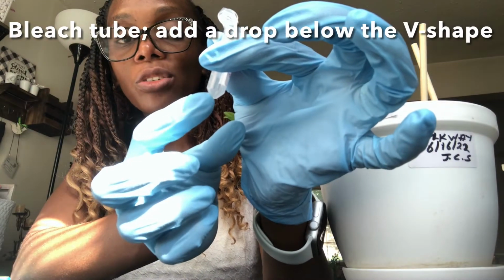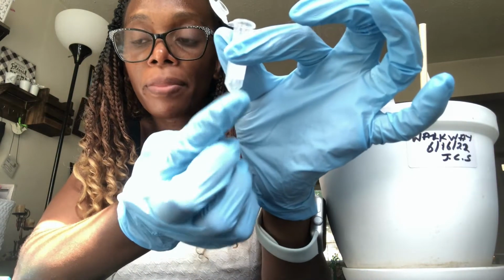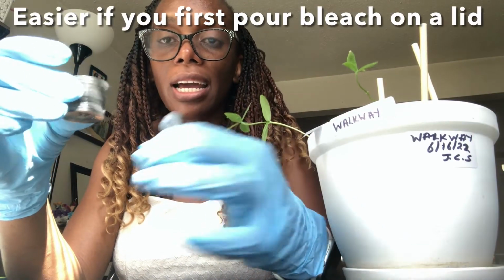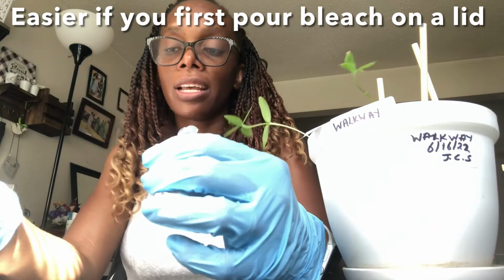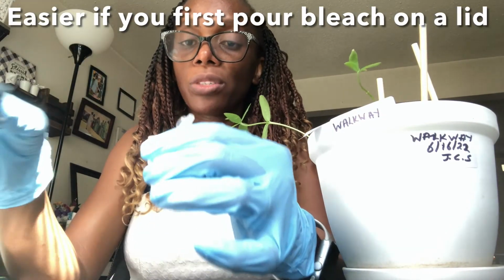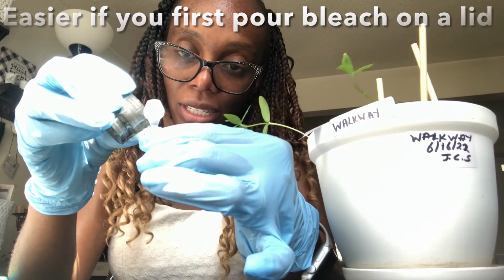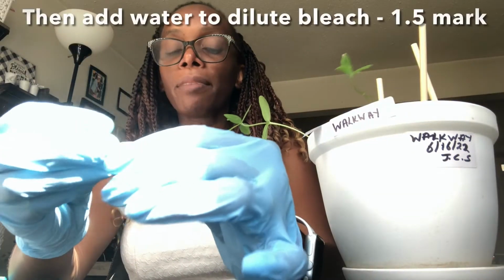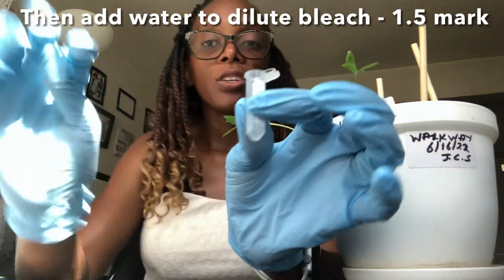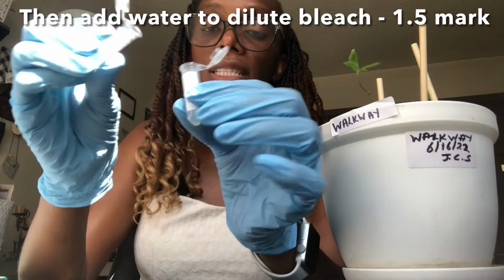Okay, so you want to have very little, like a drop of bleach, and it's easier if you put it on a lid, like I have mine, because the container is really big, and when you pour it, you might end up pouring too much. So I'm just going to put very little of it. All right, and then my next part is I have to add water. So it's actually easier if we add water from the other tube, and then we can get some more later.